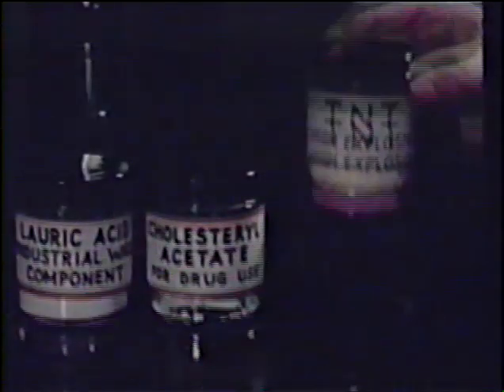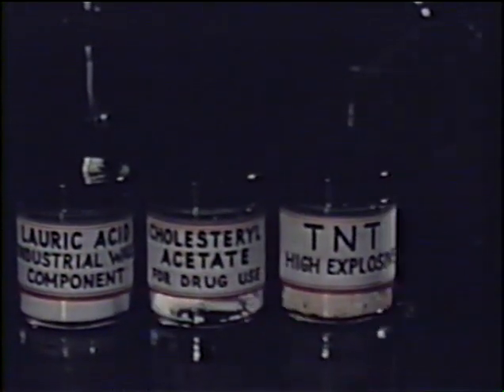Fusion methods are of great usefulness to the chemical microscopist, both in the study of industrial problems and in pioneering research. Many of the compounds to be shown were studied in research problems active during the past few years in the microscopy laboratory of the Armour Research Foundation.